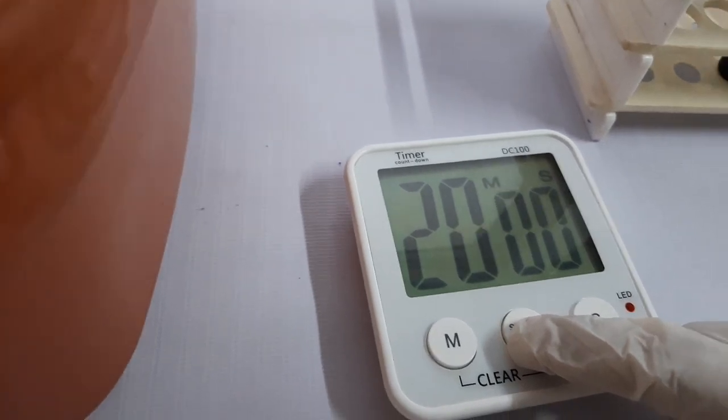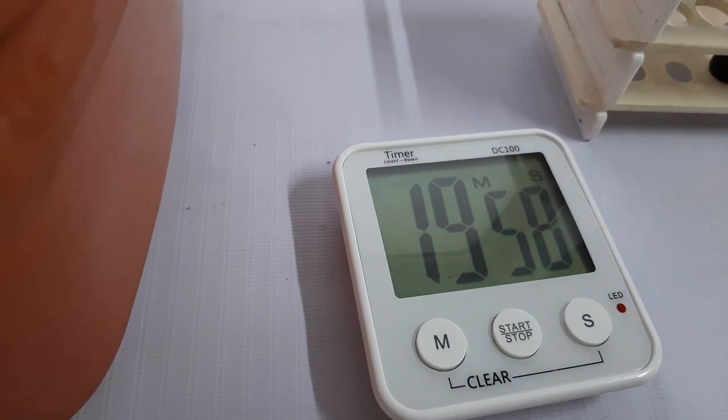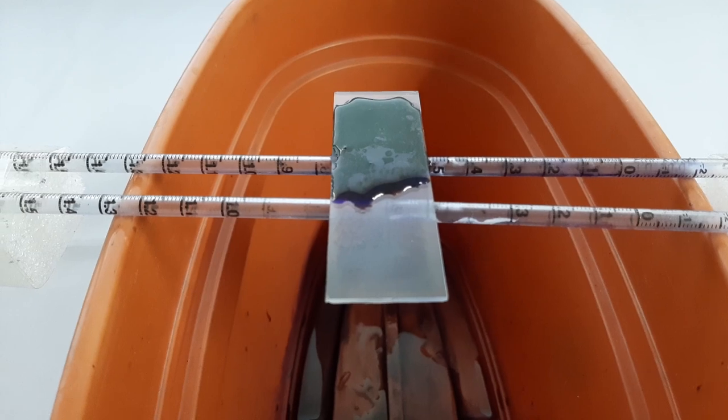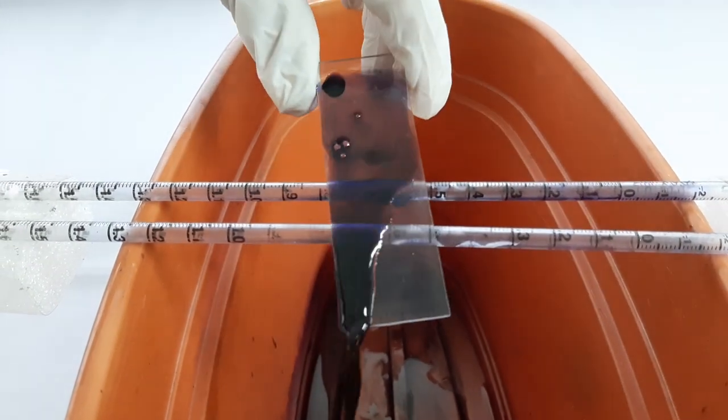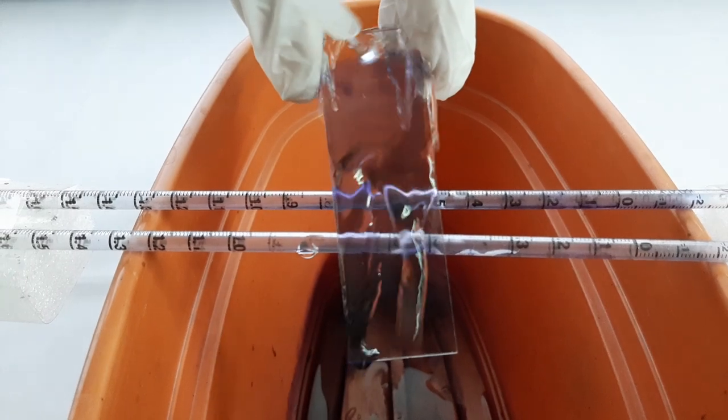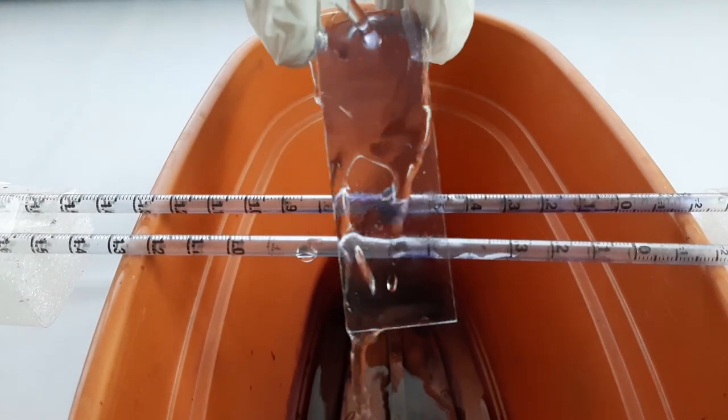And then incubate for 20 minutes. Once the incubation is over, take the slide and drain off the excess stain. And wash the slide with distilled water.